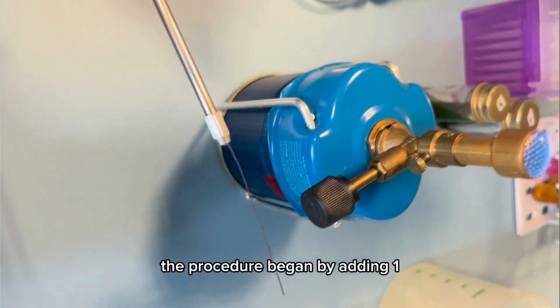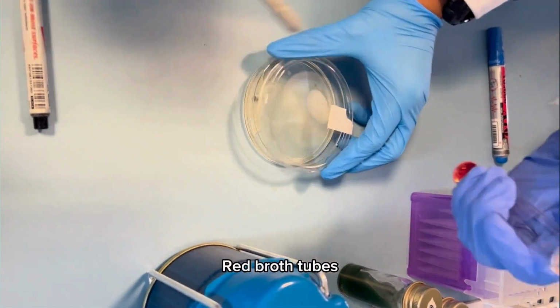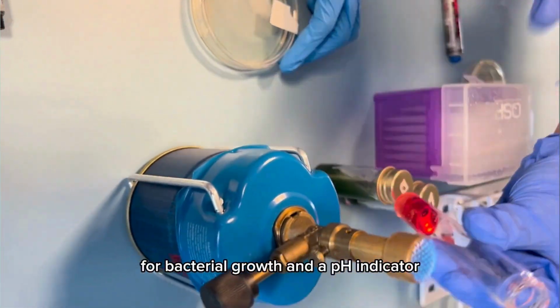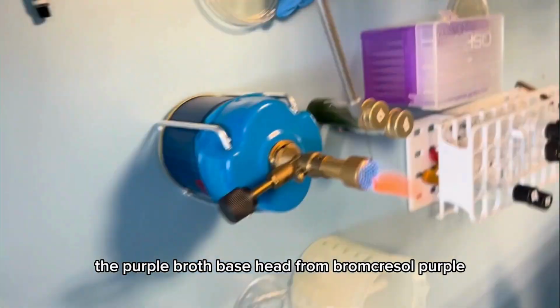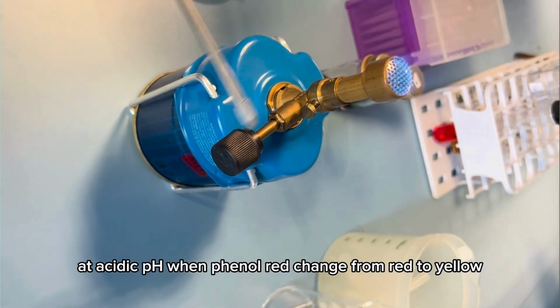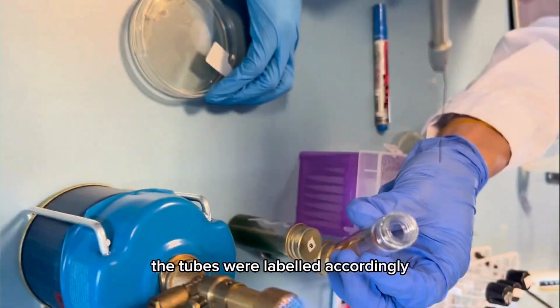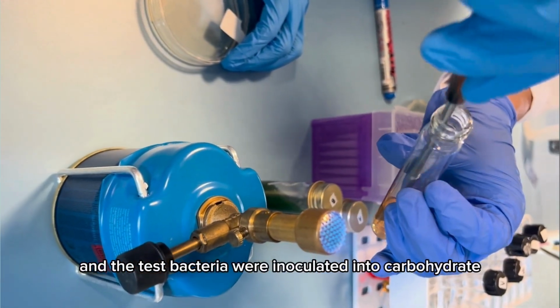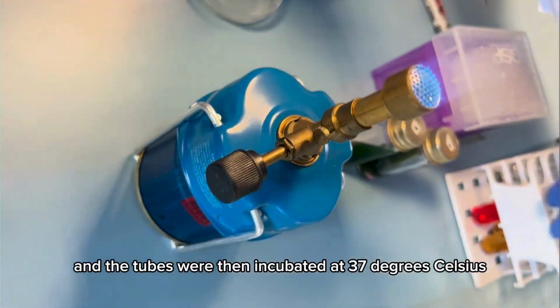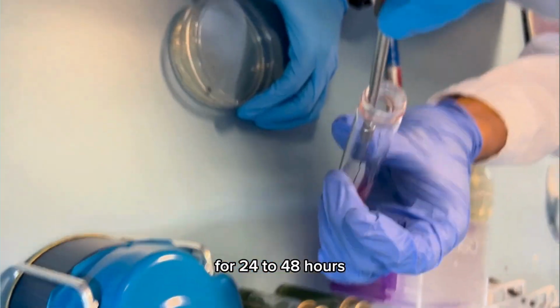The procedure began by adding 1 ml of specific carbohydrates to a purple broth or phenol red broth tube, which already contained a protein source for bacterial growth and a pH indicator. The purple broth base had bromocresol purple turning from purple to yellow at acidic pH, while phenol red changed from red to yellow under acidic conditions. The tubes were labeled accordingly and the test bacteria were inoculated into carbohydrate supplemented tubes, and the tubes were then incubated at 37 degrees Celsius for 24 to 48 hours.